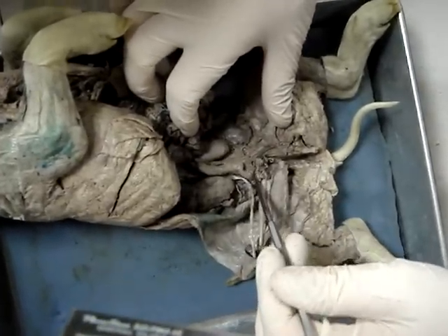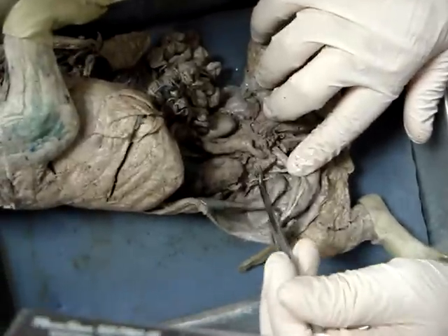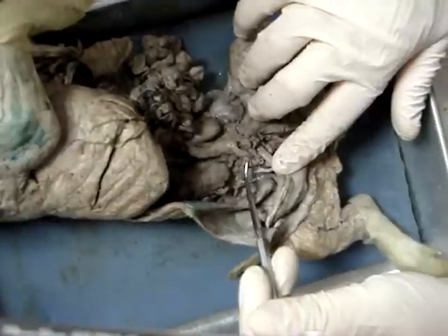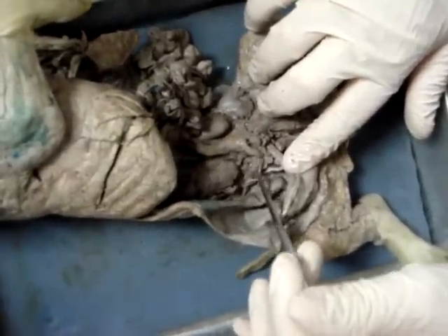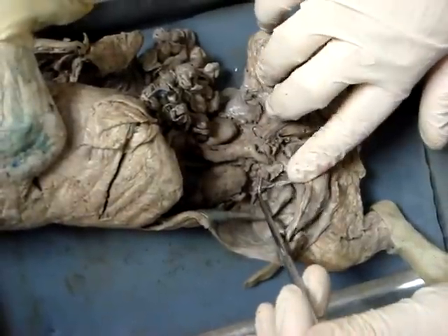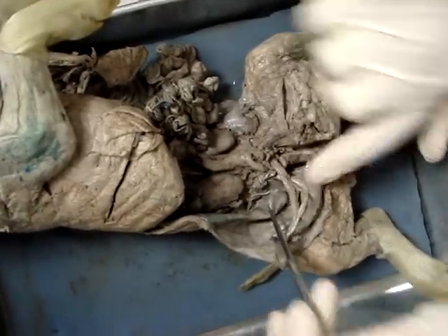You can see there are some ovaries in the way, and there's the kidney back there. Let's see if we can find the other ovary. There's the other ovary right there — a little bit bigger. And then we can see the oviduct right there behind it — tiny little squiggles. There's the oviduct, and here we have the left, or the right side of the uterus as well.